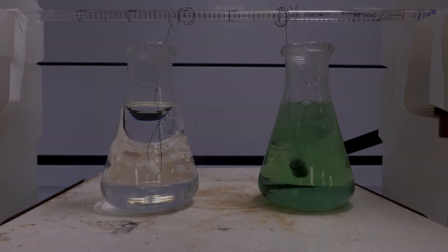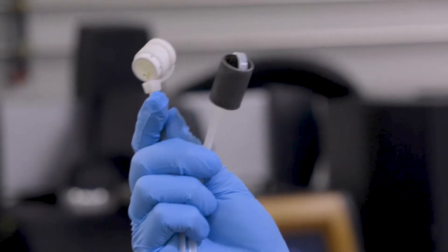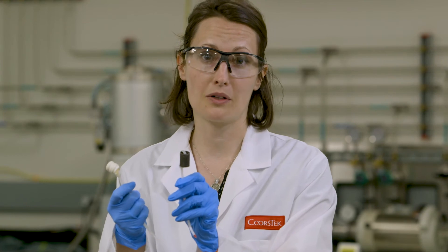Let's go check out our soda experiment. Let's really dry these off and get a look. I can definitely see when I'm looking at the surface of the metal that there's pitting on it. That would definitely affect the taste of your drink if it were in the beverage valve of the fountain drink dispenser. And the ceramic looks exactly like it did when I put it in.